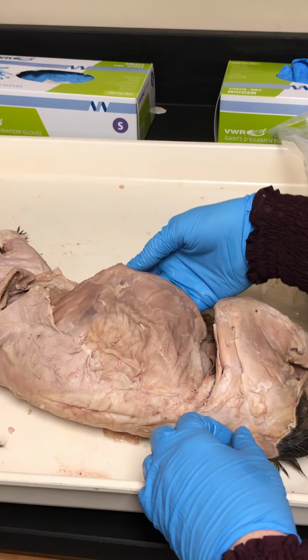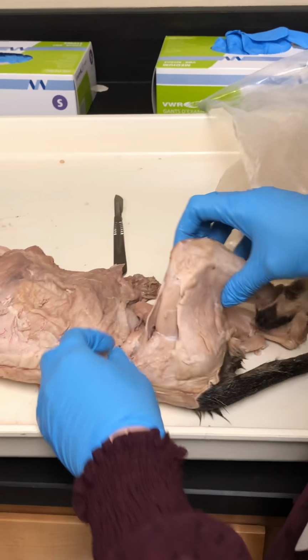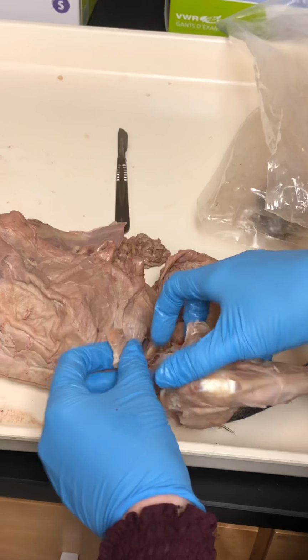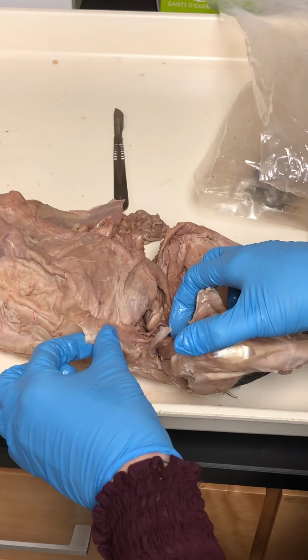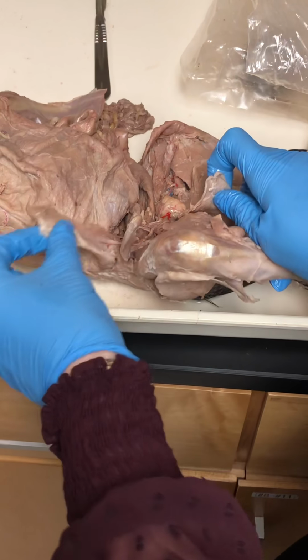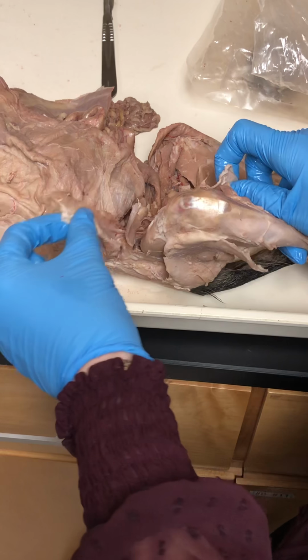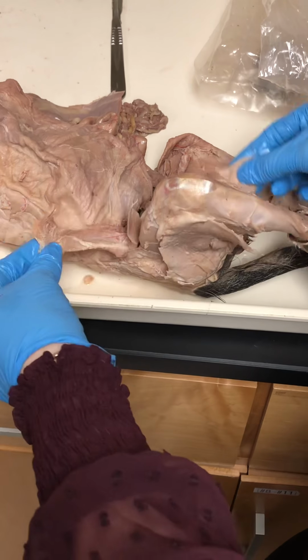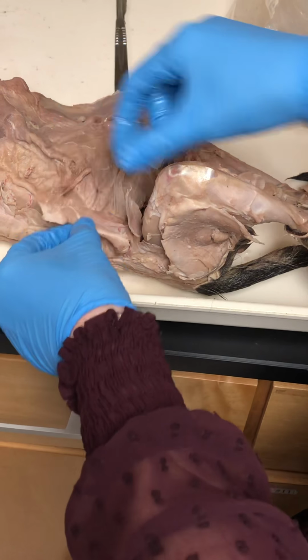Right. Okay, moving to the anterior thigh. Okay. Sartorius. So we've got two superficial muscles on the thigh. We have them on the human too, but they're a little thinner. So the sartorius and the gracilis are both these superficial muscles. The sartorius is on the lateral side. The gracilis is on the medial side. So they come together right at the knee. Okay, so sartorius is the smaller one on the lateral side.